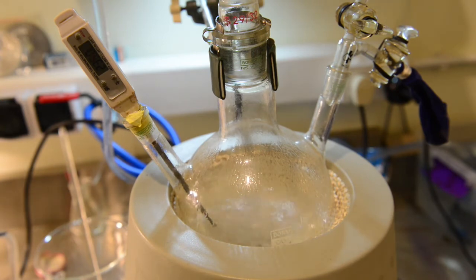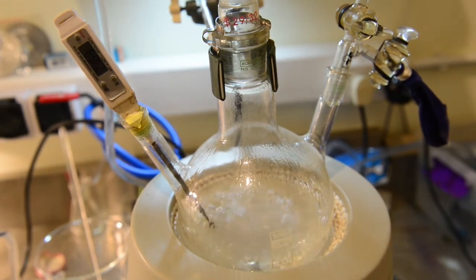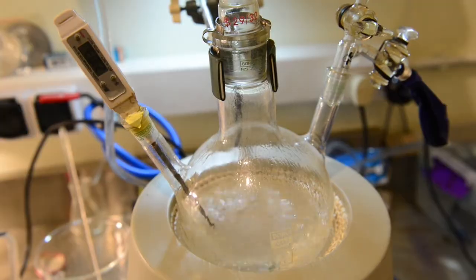After reaching 235 degrees, we lower the heating mantle, but the heating source is too strong and we overshoot a temperature, but not much. You can see the white fumes coming from the reaction flask and escaping from the beaker. A clear sign of decomposition.